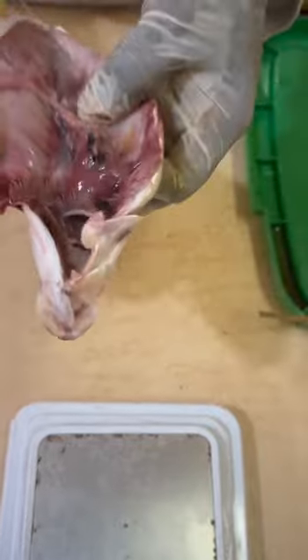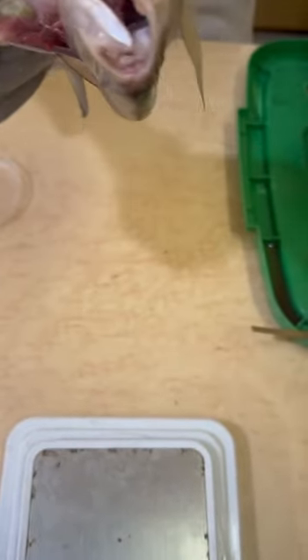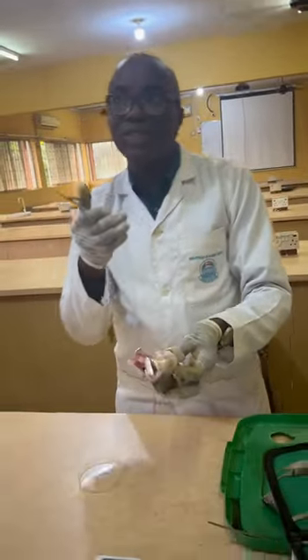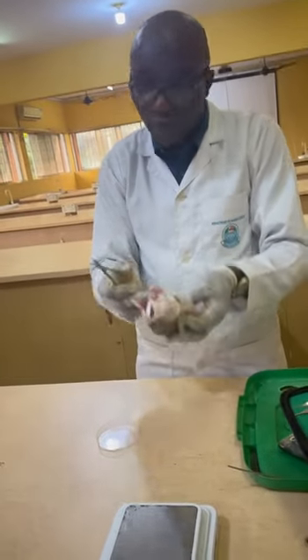Now, if it's a female, this is just a specimen. By the time we look for a bigger specimen, peradventure we might meet a female showing us clearly the features of the ovary. Maybe when we meet that along the way, we will check what stage this ovary is. So when we get the ovary, for instance, if it's a male, of course you will record it.